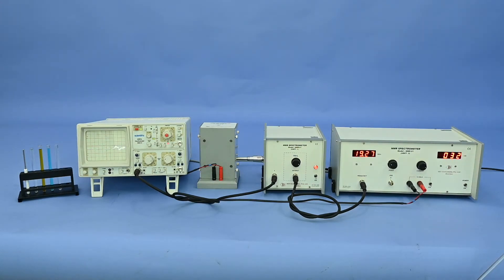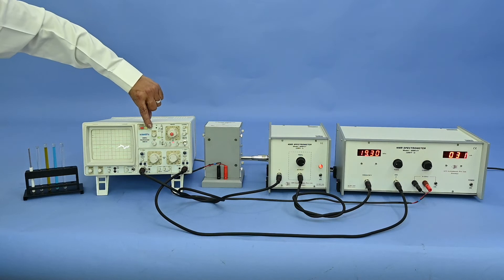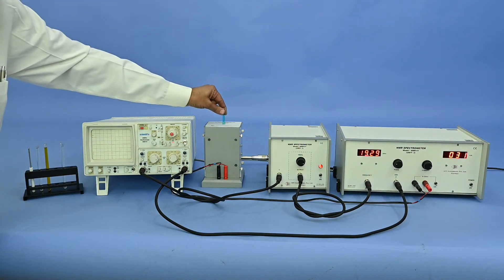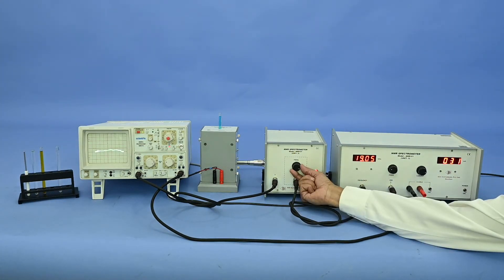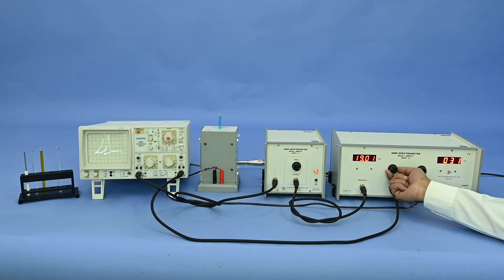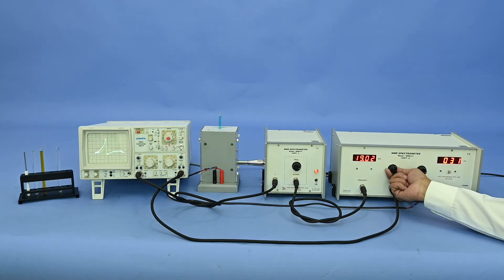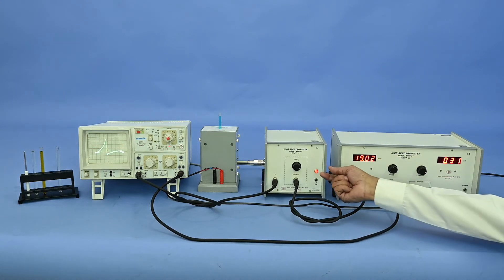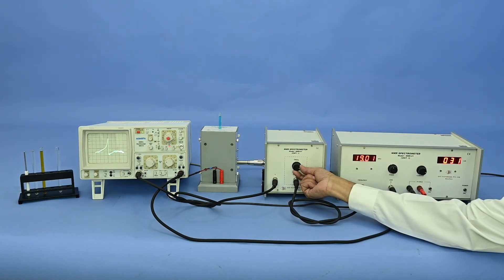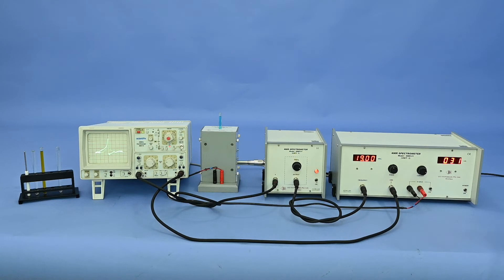Another method of determining resonance frequency is through the phase shifter. Keep the CRO in XY mode and place the sample CuSO4 again in the tank coil of unit 2. Rotate slowly the frequency control knob to get 2 peaks. With the help of the phase shifter, combine the 2 peaks and rotate the frequency knob to shift the position to the center of the display. Now the frequency displayed on the panel of unit 3 is the resonance frequency.